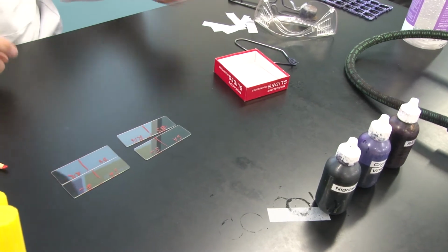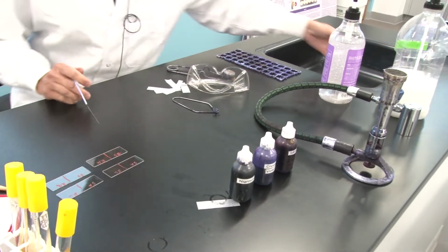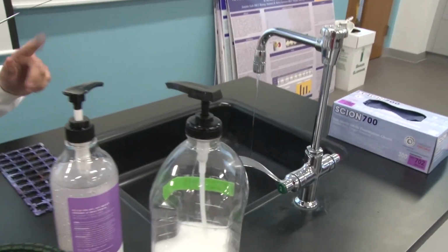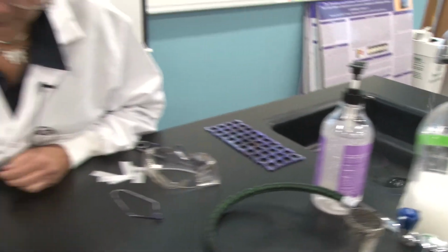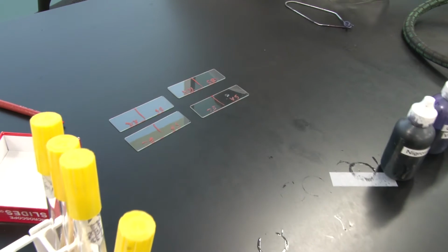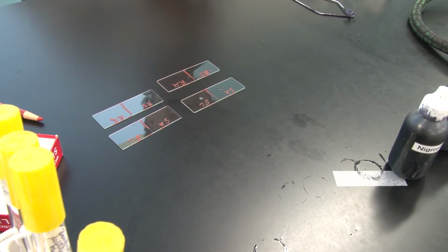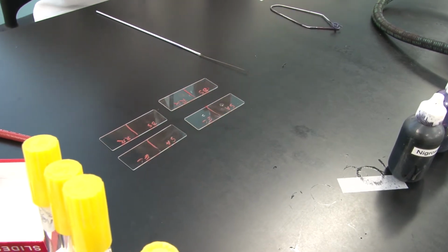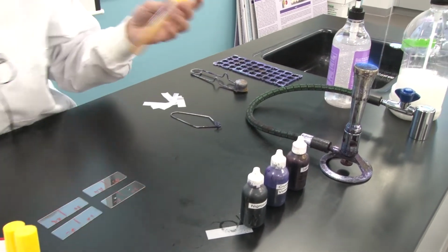Okay, now I'm going to make some bacterial smears. When you make bacterial smears, we're going to come over to the sink just a second. I'm going to actually just grab a loopful of water in my loop. Tap water is fine. And I'm going to place that on my first slide. I'm going to put a dollop of water in the middle of each of the halves of that slide. I need to put my goggles on, light my fire, and now I am going to grab Staph aureus, my first stock.